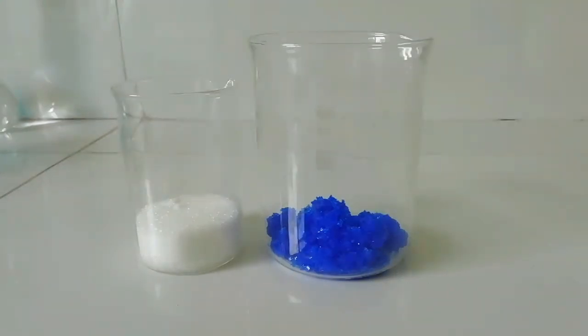Here I'm using a little extra amount of copper 2+. The sodium citrate is the limiting reagent, so I have excess copper chloride to make sure all the citrate is precipitated out as copper citrate.